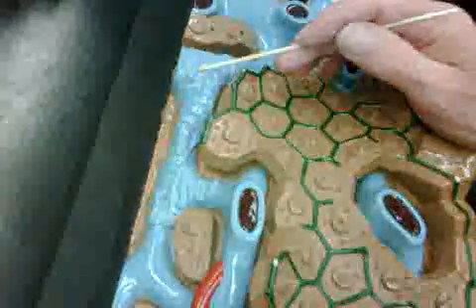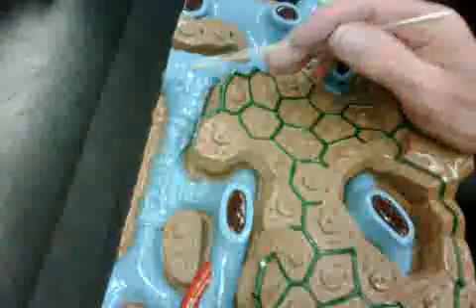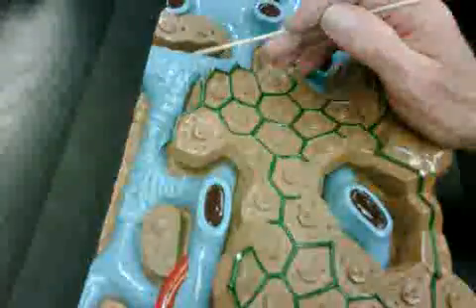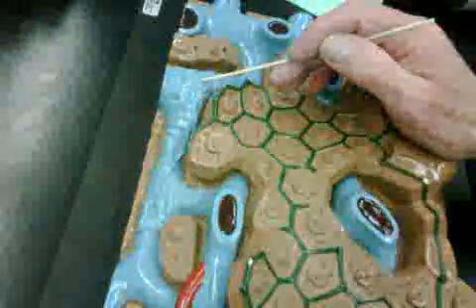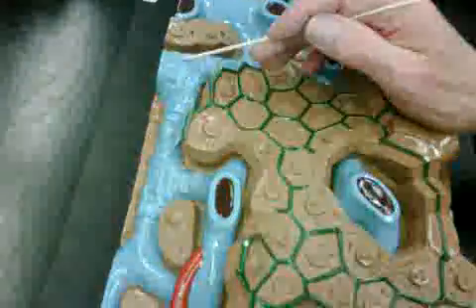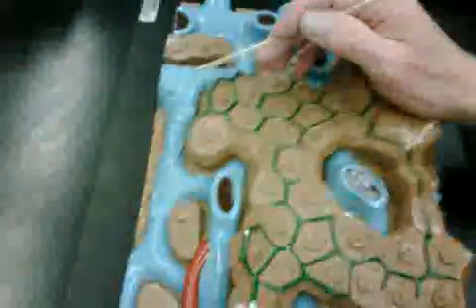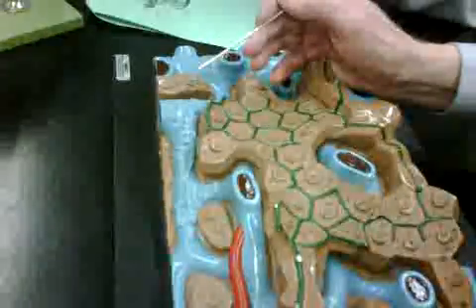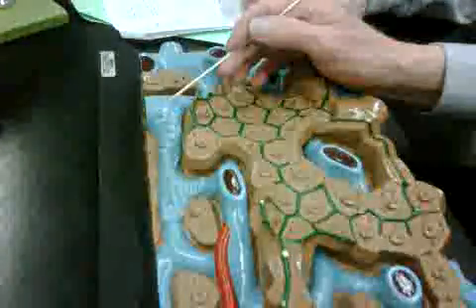What do you call this? Right. You got your list there. I wasn't here when we did this. Is this the reticular fiber? Reticular fibers. So the reticular fibers support these venous sinuses, these hepatic sinuses, so that they stay open, they don't collapse.